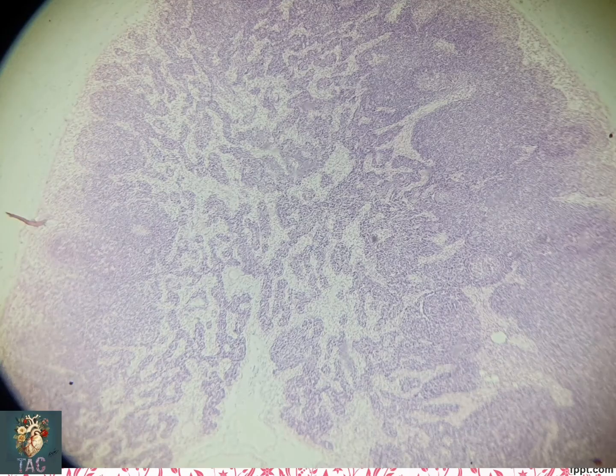So students, this is another slide for the lymph node, and this is an H&E stained section. Here you can see the outer area is the capsule, and just beneath this light color area is the subcapsular sinus. Here you can see the trabecular sinus, which then opens into medullary sinuses present in the medullary cords. In the area of the cortex you can see multiple lymphoid follicles are present. In the lymph nodes, these are either primary follicles or secondary follicles.